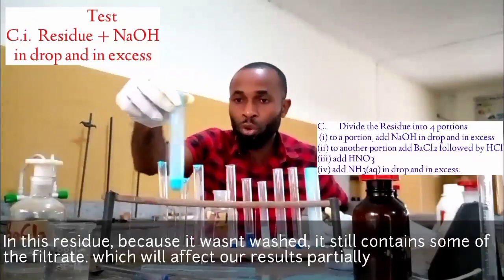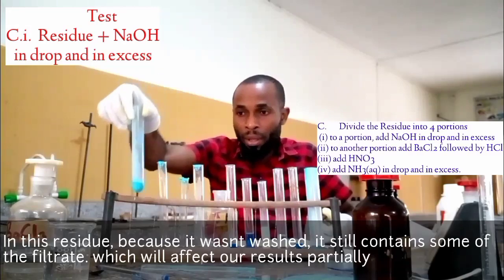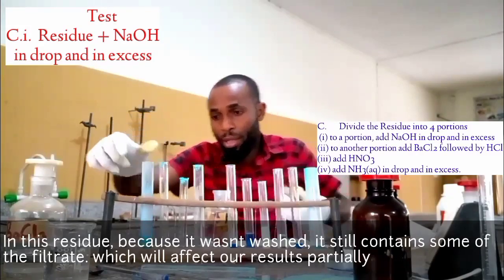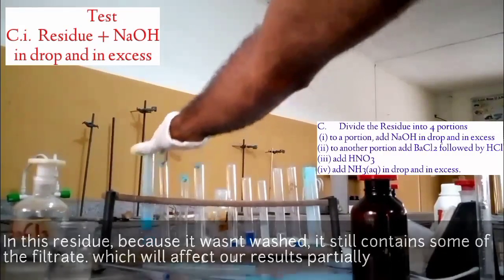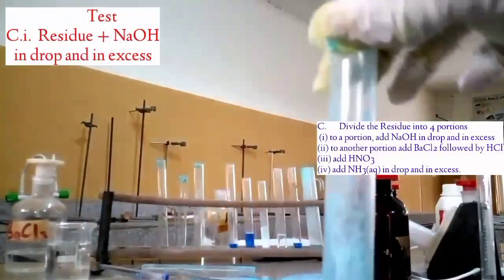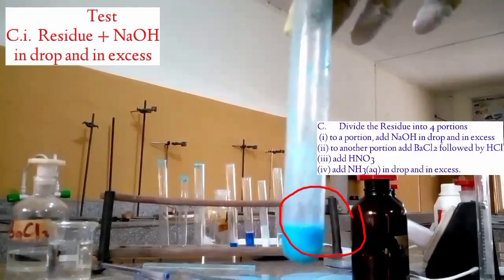There is a pale blue showing. Let me check if you are seeing it. Pale blue precipitate. Watch, you can see the pale blue showing.